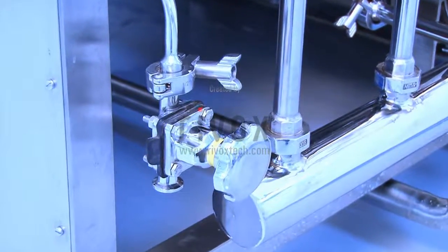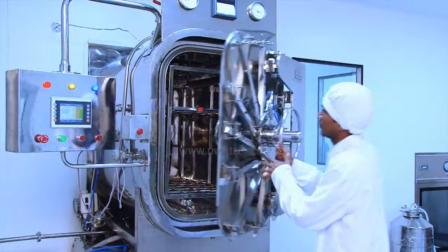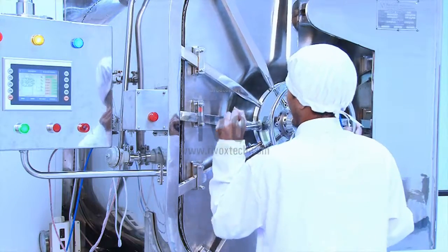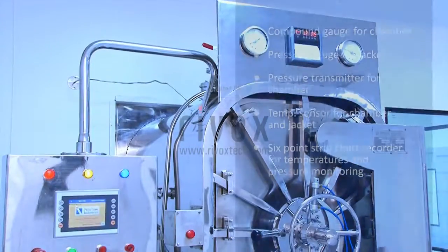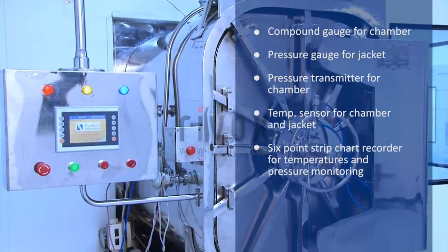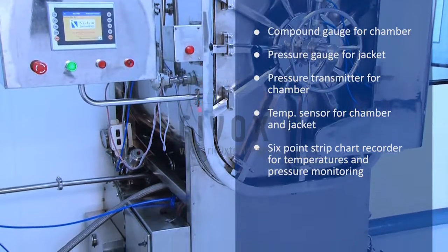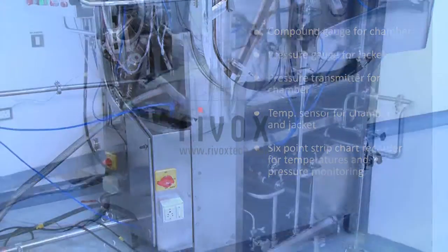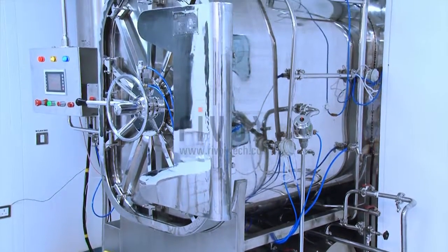Validation ports are provided for insertion of multiple temperature sensors for validation of the sterilizer. A water ring type vacuum pump is included for process vacuum, along with a steam sampling valve for checking steam quality. The control system is fully automatic, PLC and touch screen based, with F-zero calculation for automatic computation of process lethality.